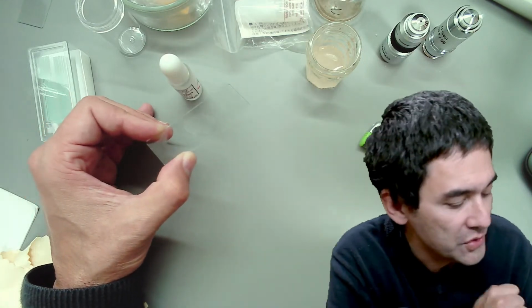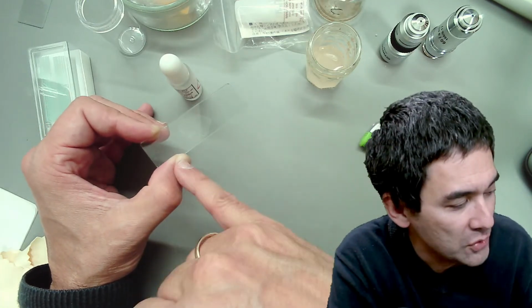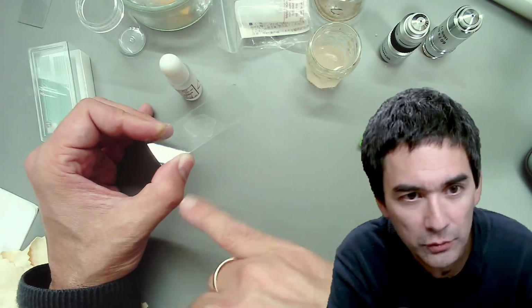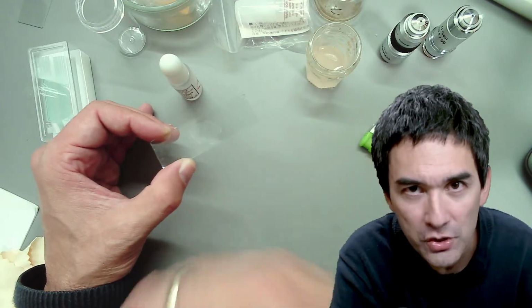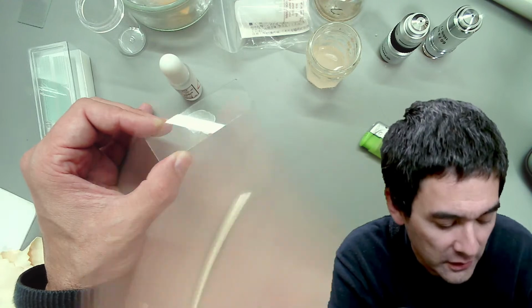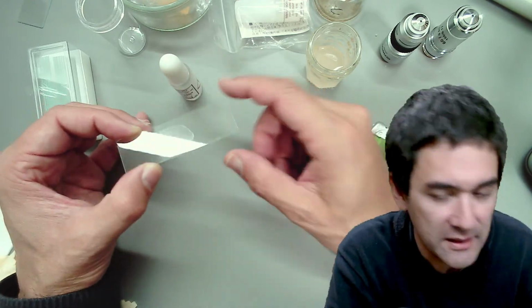I'm not going to stain them right now, but when I use oil immersion, I don't think that the immersion oil is going to remove them, but you just want to make sure. I just want to make sure that they're baked to the slide so that the immersion oil does not wash them off. Okay, that's the idea here.